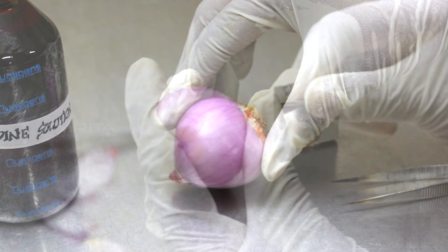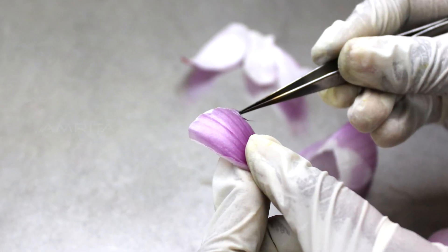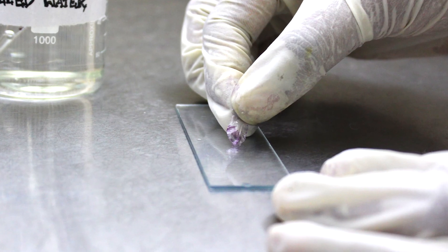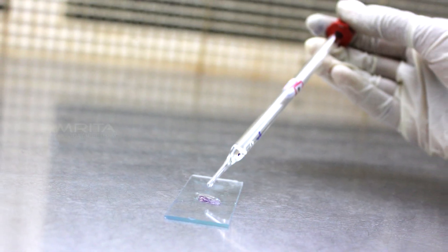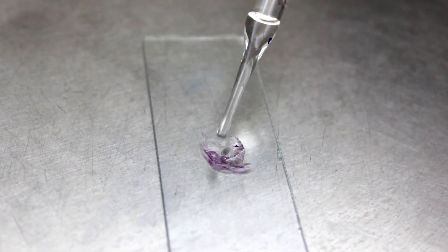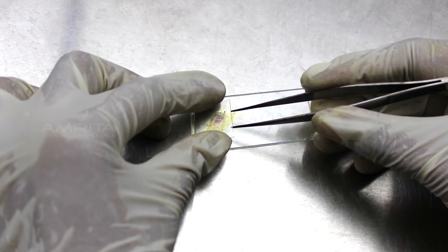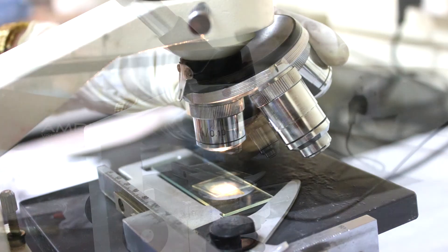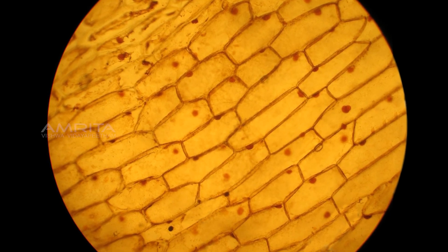First, take an onion and peel off the outer layer using a scalpel. Using the forceps, carefully peel off the thin red outer layer of the onion and place the section over the slide. Add a drop of distilled water onto the onion cells and spread the onion peel properly. Add one drop of iodine solution and place the cover slip properly over the section on the slide. Place the slide on the stage of the microscope and observe at 4x, 10x, and 40x. We can clearly view the onion epidermal cells through the microscope.